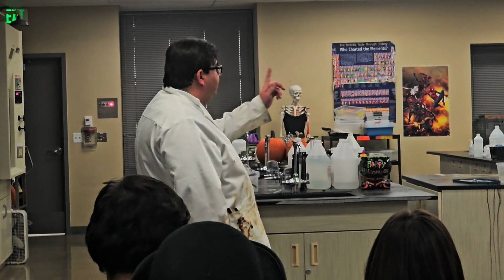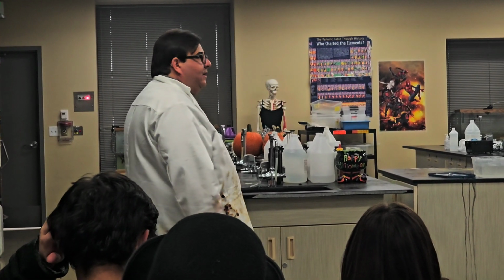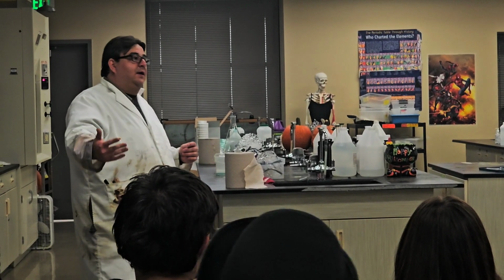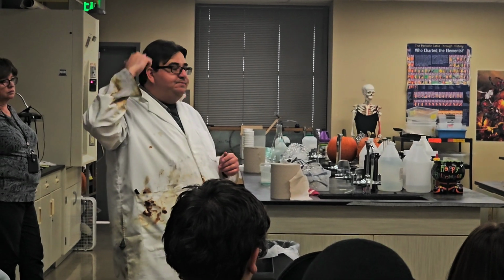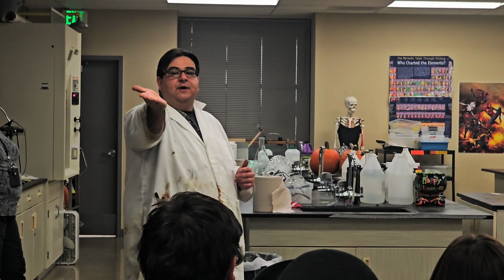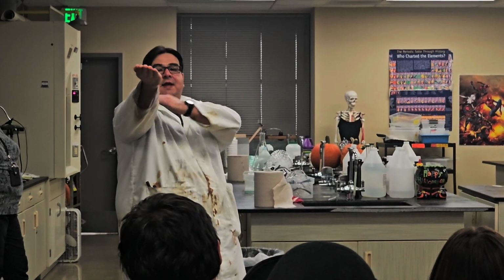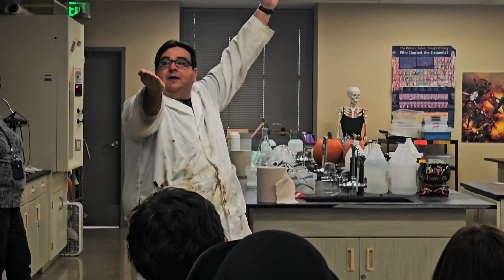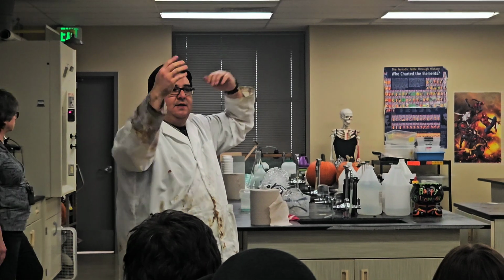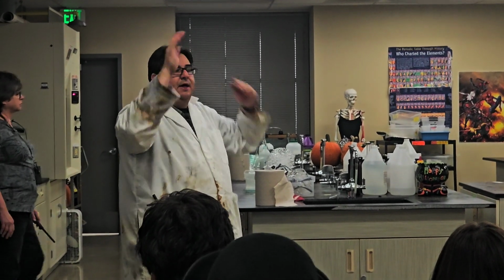So a couple safety things, because there's a bunch of us. Just make sure that you're not rushing. There's plenty of time. You'll be able to do everything. So lighting hand on fire over there, spirit wall, and then over here with the bubbles. Couple things. What direction does fire go? Up, okay. So when you are coming over here with Miss Basil, you want to make sure that your hand is out, nice and long, and about eye level, so that the fireball goes up and around your head, not towards your head. I don't want to burn off your eyebrows or your hair, okay?